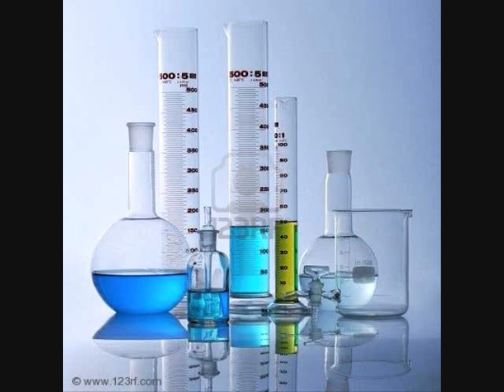Our hypothesis is that there is going to be 2.5 milligrams per milliliter of Blue No. 1 dye in a single serving of Gatorade Blue Glacier, because it appears dark, which makes us think it has a high concentration of Blue No. 1 dye.